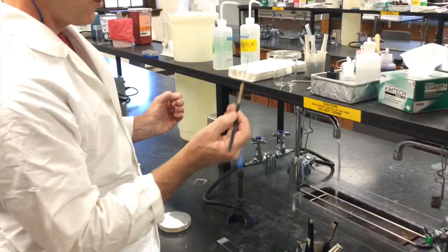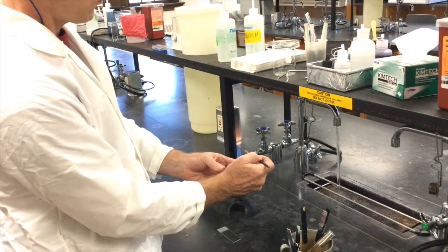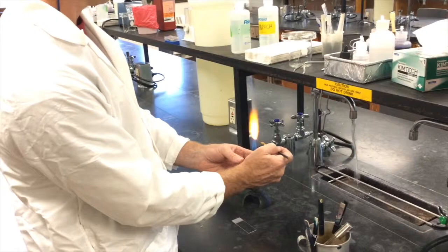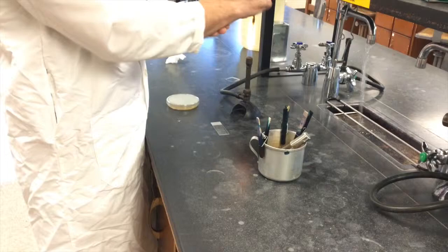And now, you've got a lot of cells and liquid in this loop. You want to prevent aerosols. So do not put the loop right into the flame. You want to put the loop just outside the flame, heating it up quickly to watch and dry out the loop. Once your loop looks dry, then place the loop into the flame to sterilize it.